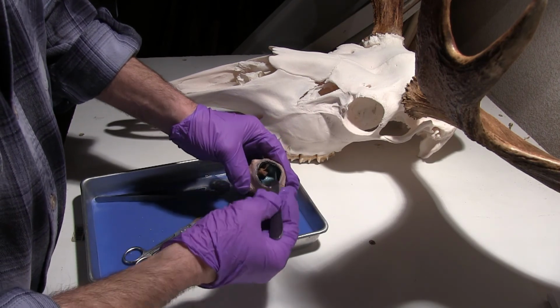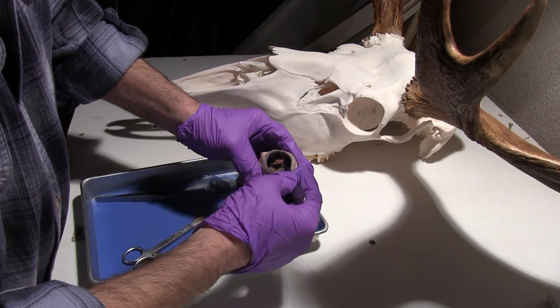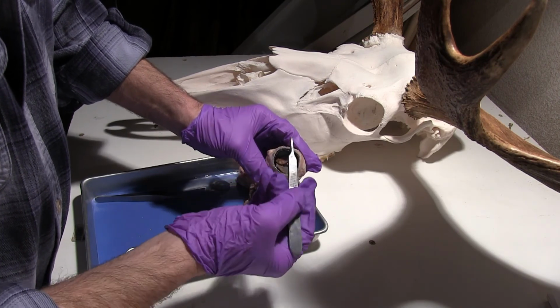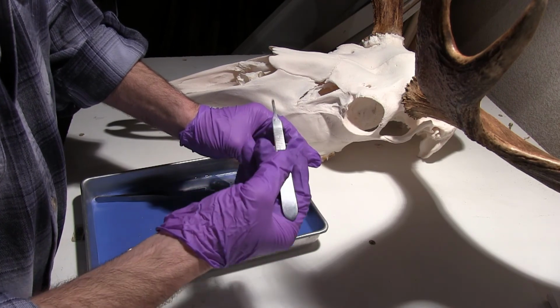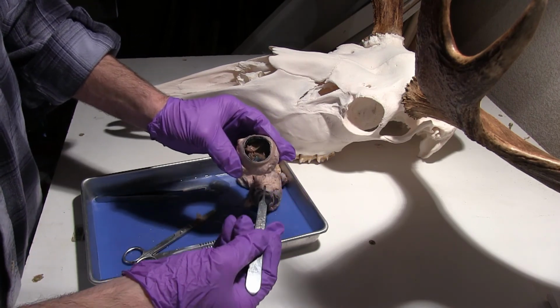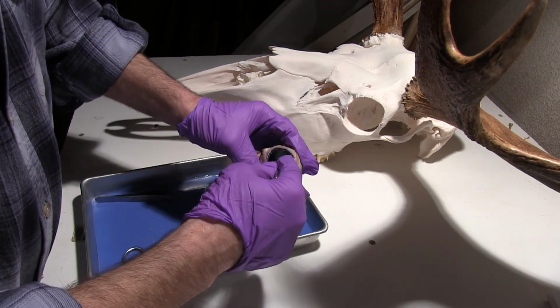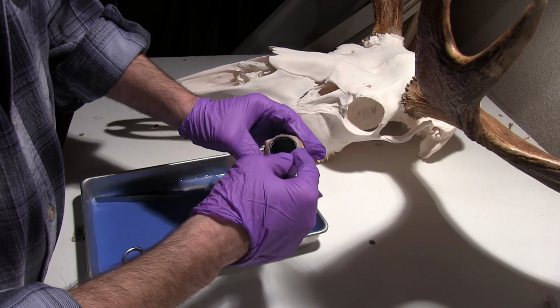And the tapetum lucidum is actually going to have, this is going to be the area where we have a lot of our photoreceptors. And what will happen is light will pass through here, it'll hit the tapetum lucidum, and it'll reflect back on the rods. So basically, that's giving us better night vision, and that's a specific structure to animals that need to be active at night or see at night.